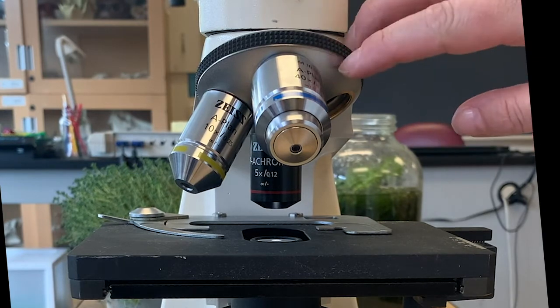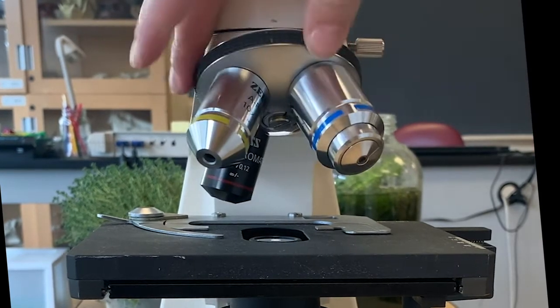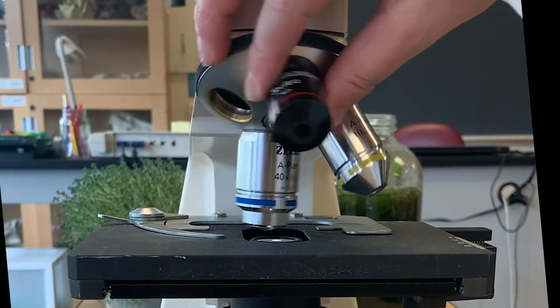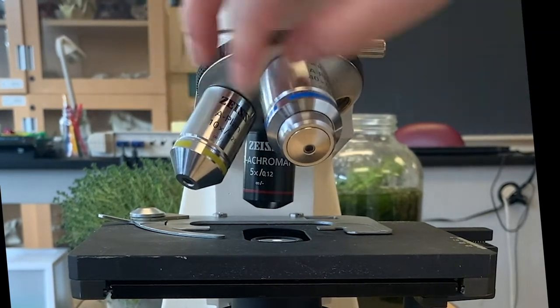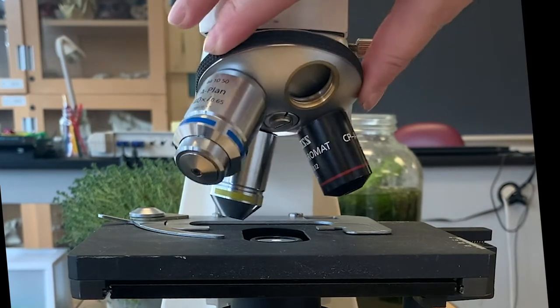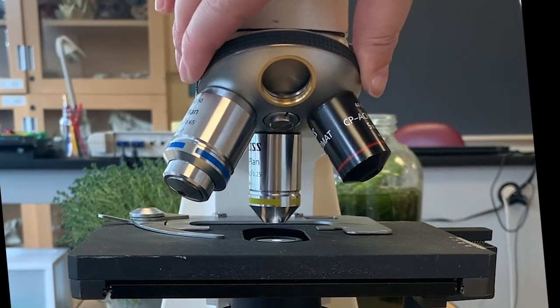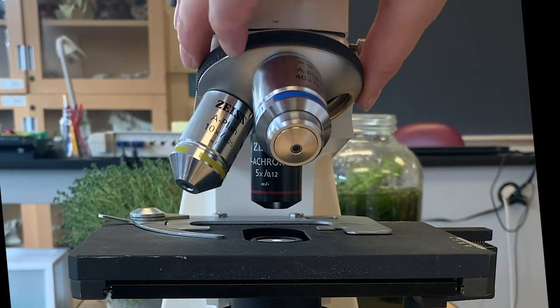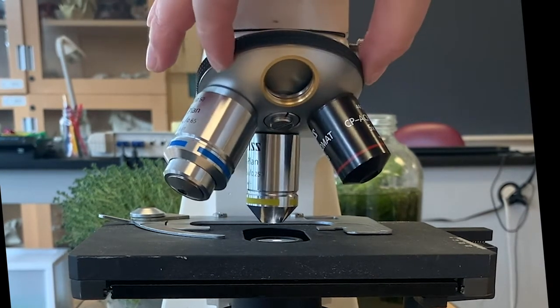Here we have our three objective lenses. We have a 5x lens, 10x, and 40x. These just progressively increase the magnification on the specimen. You can also see they get closer to the stage as you go up in power.